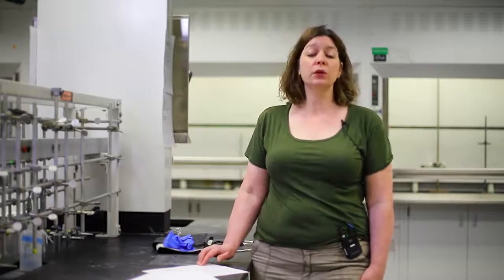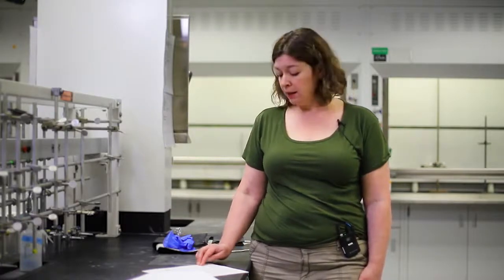Before you come to lab, you need to make sure that you've read through the procedure. You need to make sure that you know what each step is going to do, and that you understand it before you begin. If the procedure calls for gloves or tells you that you need to have extra ventilation, then please be sure that you do this. Work carefully and pay attention to what you and what others in the room are doing.